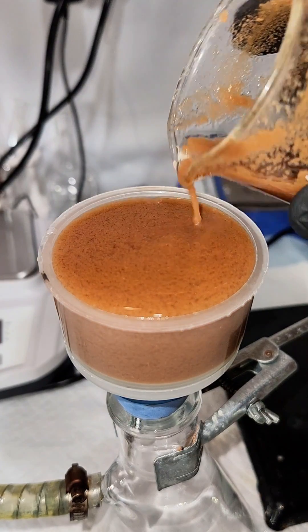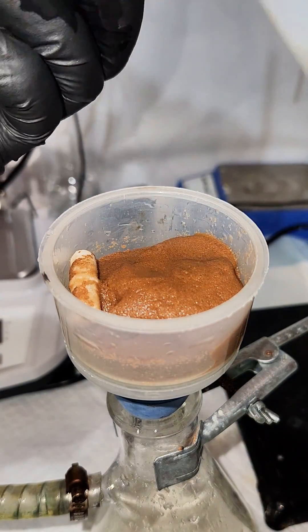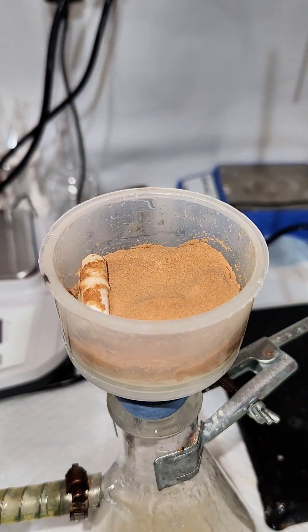To that end I just rinsed it thoroughly in ice cold water and then desiccated it overnight and my final yield is 3.11 grams which is about a 65% yield.